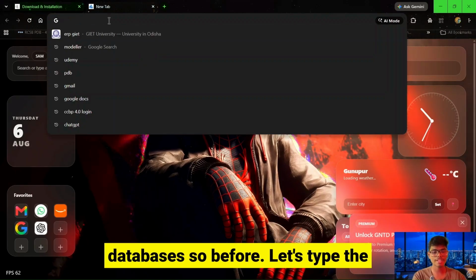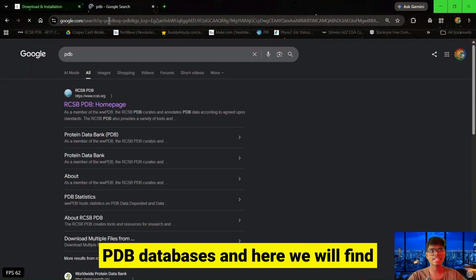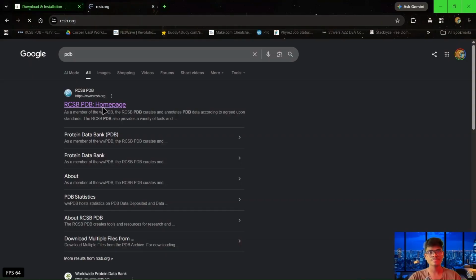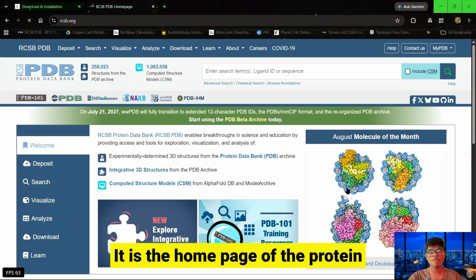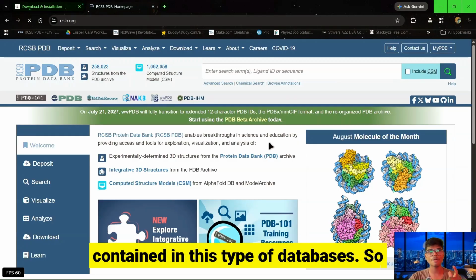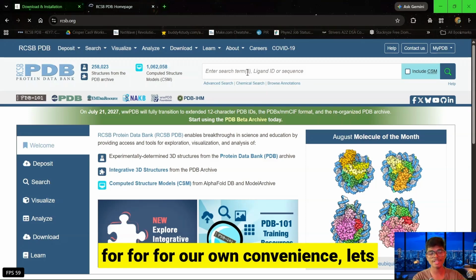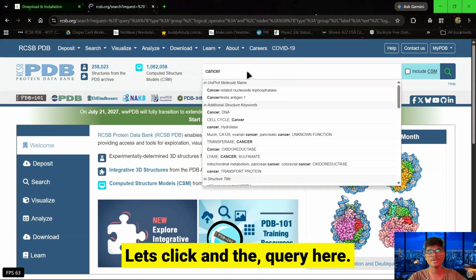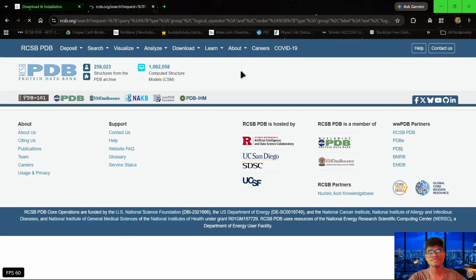Before going, let's type the PDB database, and here we will find the RCSB PDB homepage. It is the homepage of the protein structure repository contained in this type of database. For our own convenience, let's start by searching for a cancer protein.